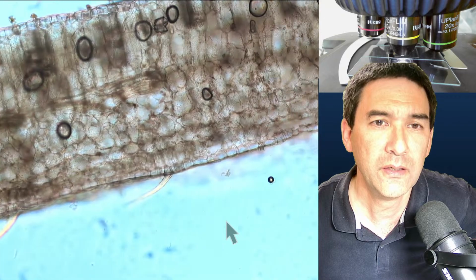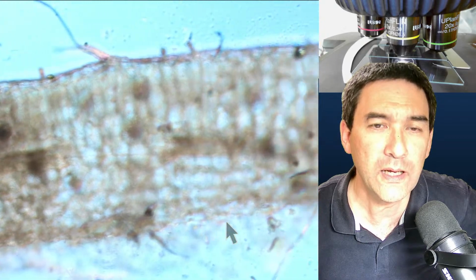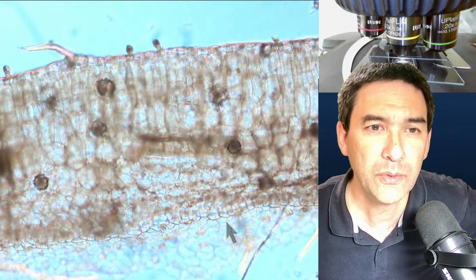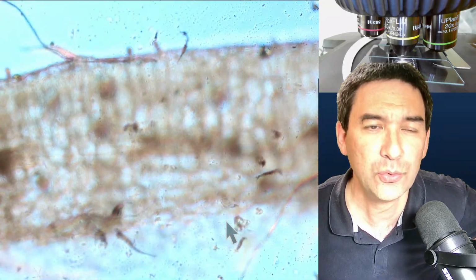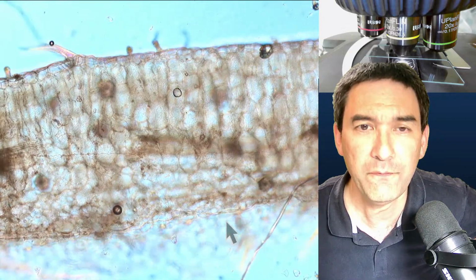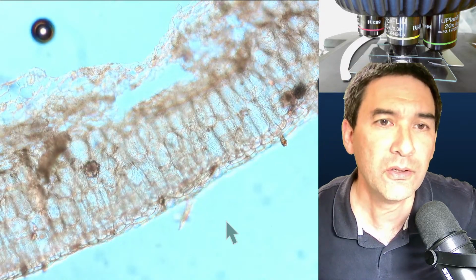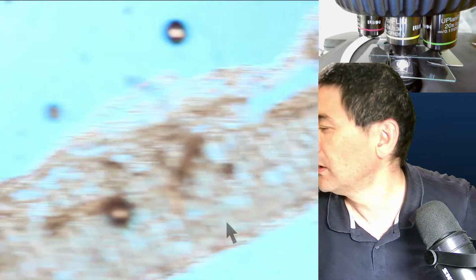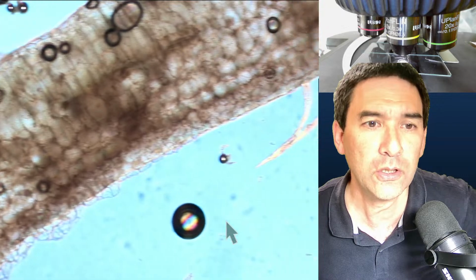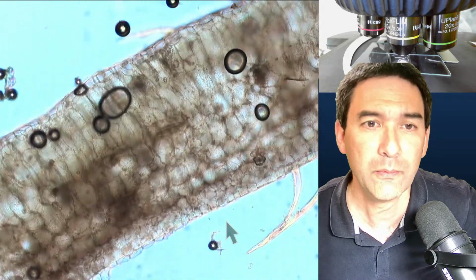So this is basically the one that has been treated in alcohol. You see a whole bunch of air bubbles over here, and over here. Look, this seems to be a nicer part over here. When it goes into focus and out of focus again, I do not see a second cell layer going into focus. So you see, it's fairly thin. If we want, we can look at another one over here. Look, this is actually even thinner. And that's the third one over here. So basically, the take-home message is that concentrated rubbing alcohol can be used to make some of the parts a little bit more visible.